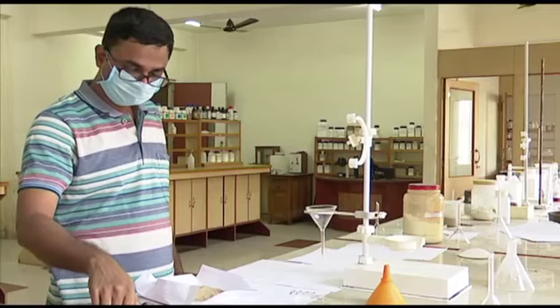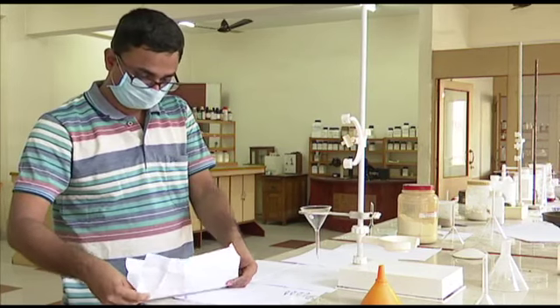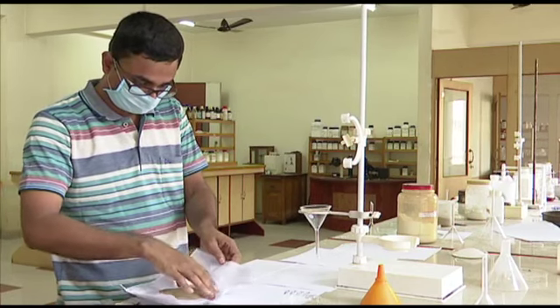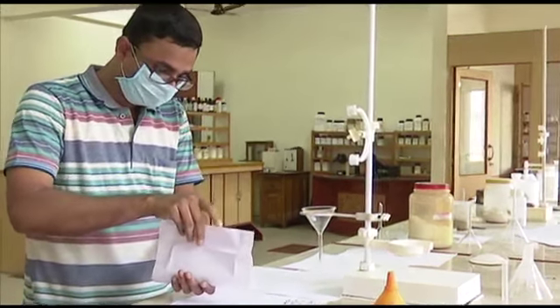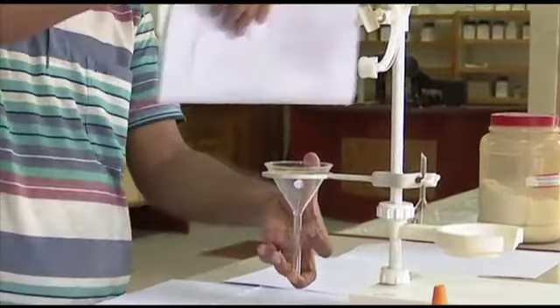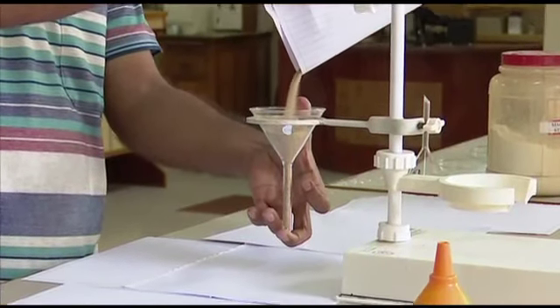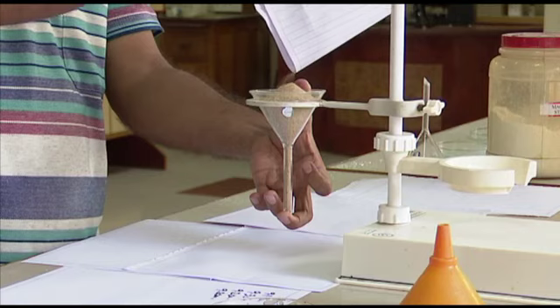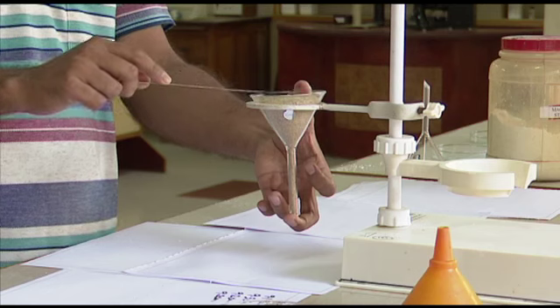For comparison purpose, we are performing this experiment with another material. Here we have taken sand, the sand you see every day, and you will see how it's flowing under the similar conditions. We did not change anything, the same stand, same height, same funnel, same extent of filling, but the material is different. So the purpose of performing this second experiment is just comparison, how the change of material changes the angle of repose.